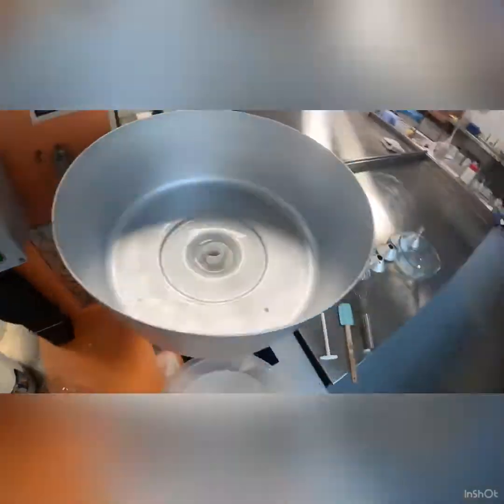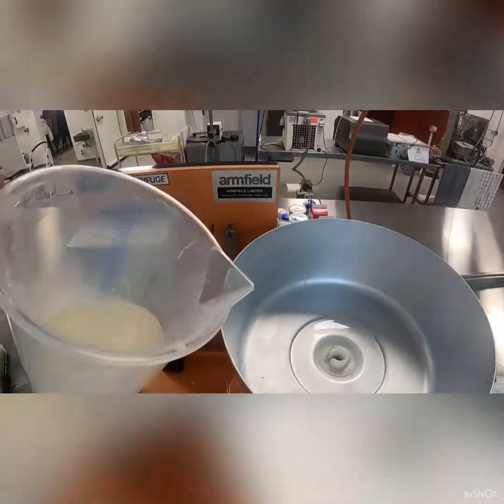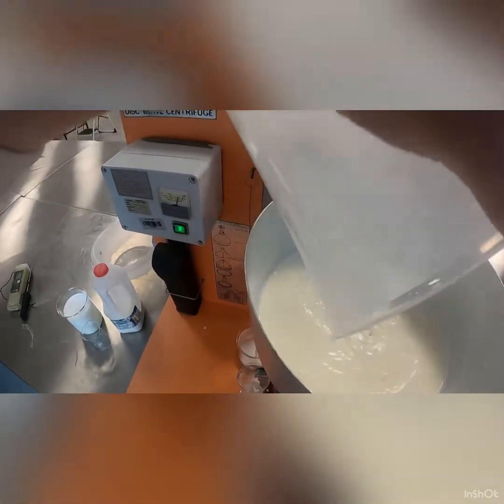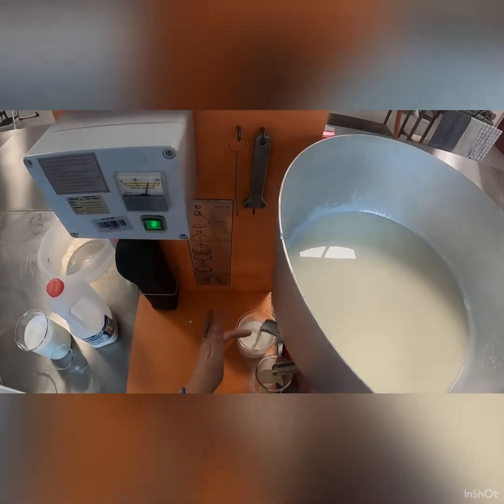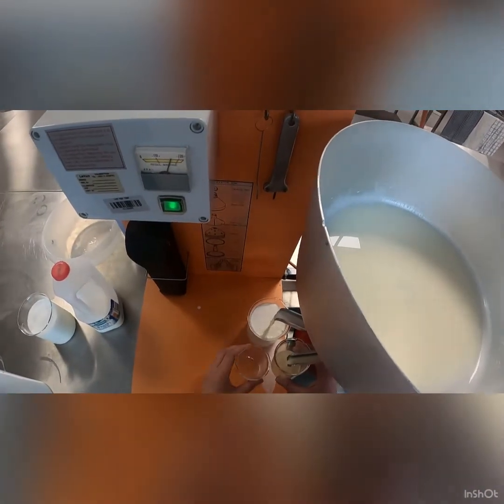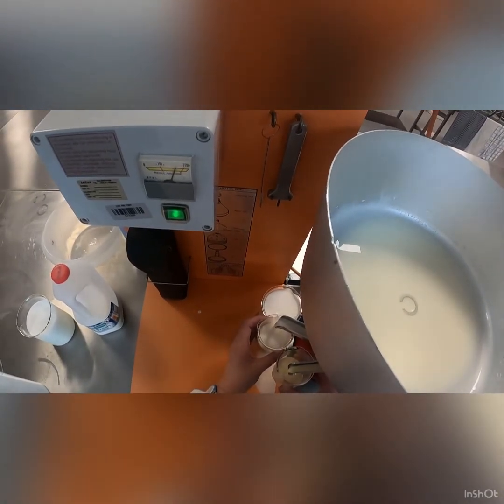We take this one away — a beaker there and a beaker there — and I'm going to add in this raw milk sample. So immediately we can see the difference: there's a lot of milk coming out here and there's a lot of cream. What's actually happening is we have skim milk coming out one side, and we have cream coming out the other side.